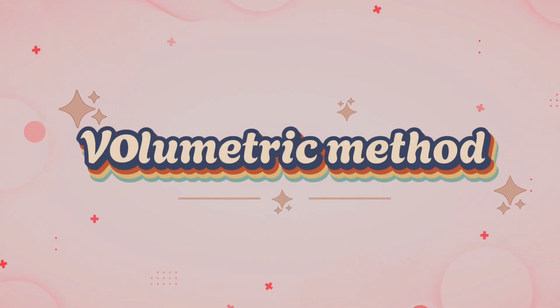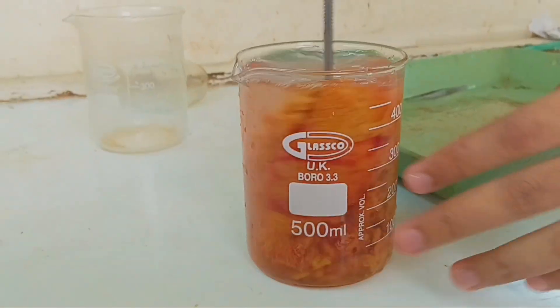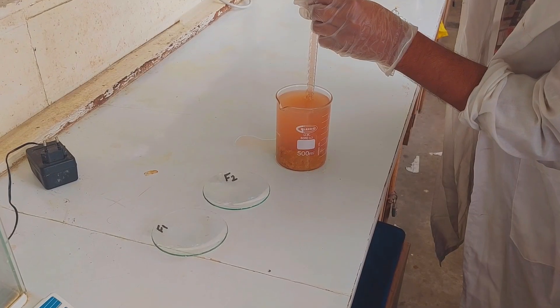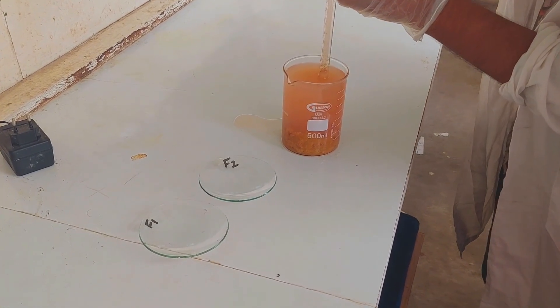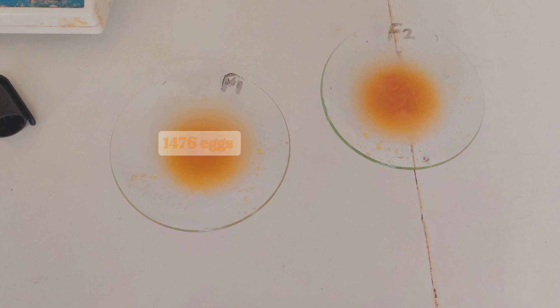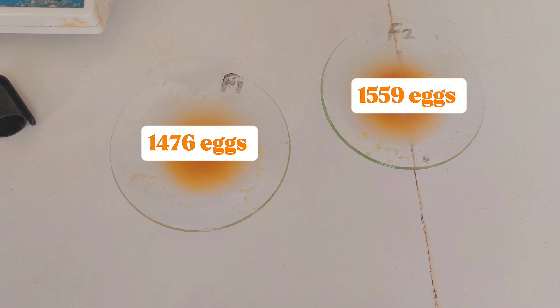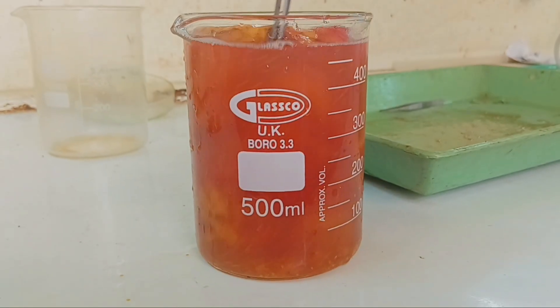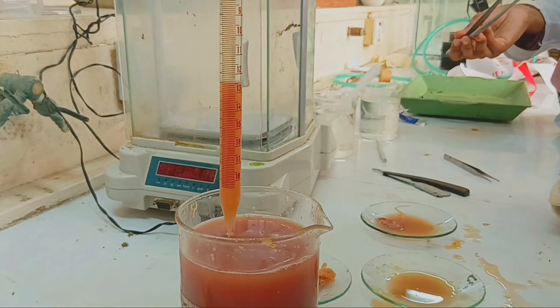For the volumetric method, we first measured a known volume of water in a measuring cylinder. Then we added the cleaned eggs into the water. After mixing the eggs properly in the water, we took two subsamples labeled F1 and F2 using a pipette, and measured the volume of each subsample carefully. We counted 1,476 eggs in the first subsample and 1,559 eggs in the second. The total volume containing the eggs was 500 milliliters and the volume of each subsample was 5 milliliters.